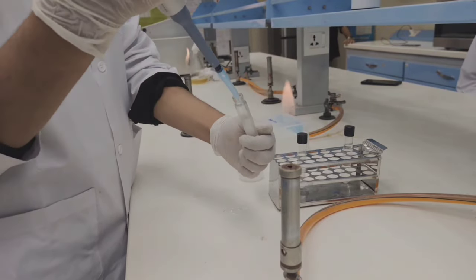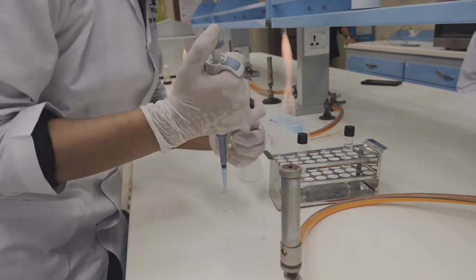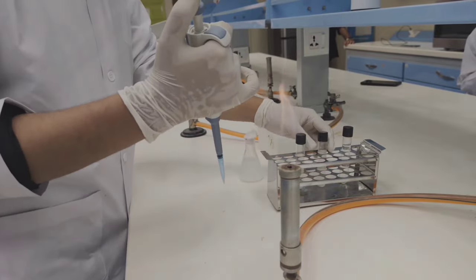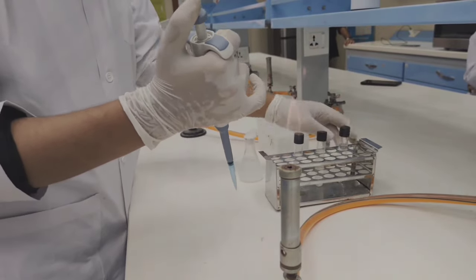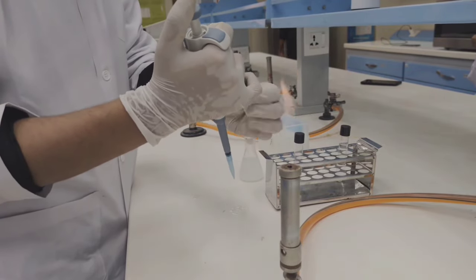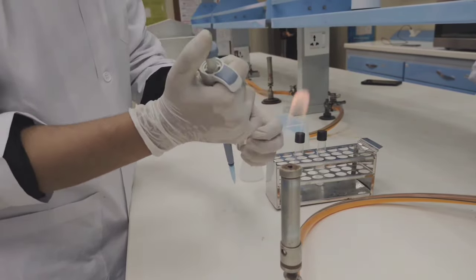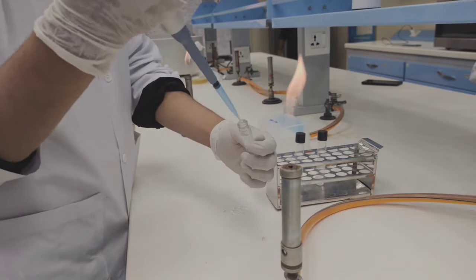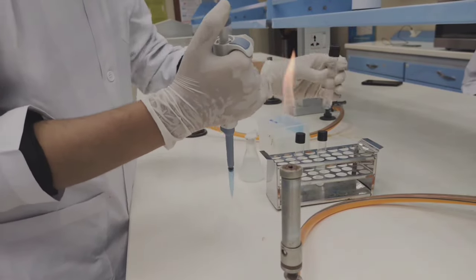Then by this method three dilutions are formed. Now for fourth dilution, again we have to inoculate a sample from that test tube, from the last test tube to another test tube. By this way four dilutions are formed and this fourth step is completed.